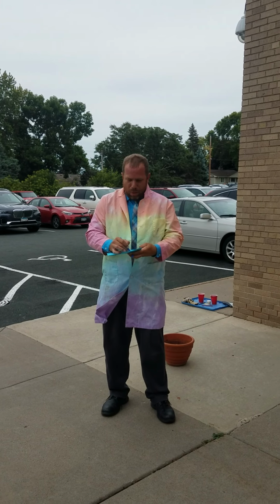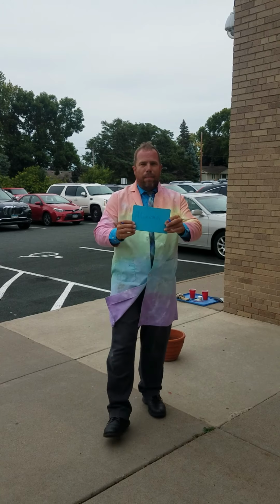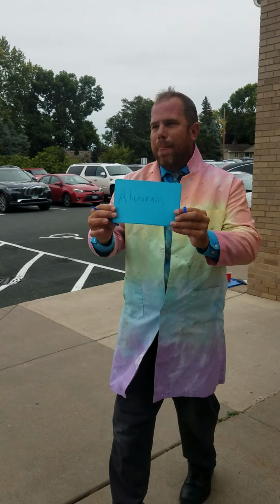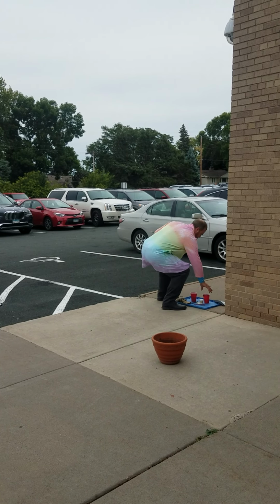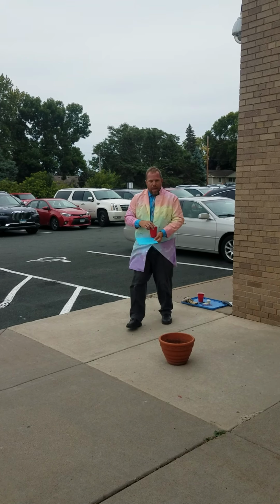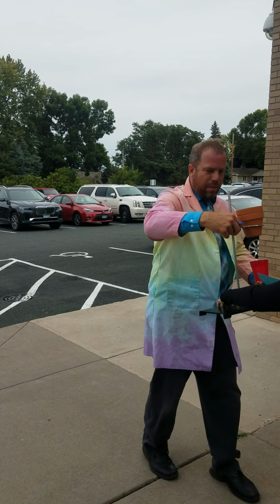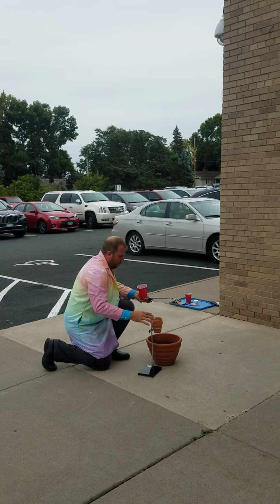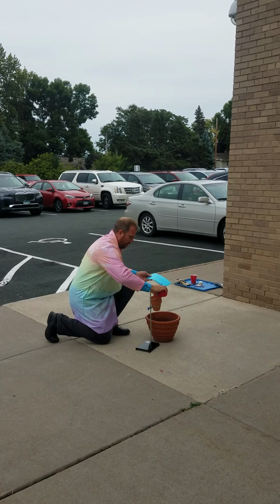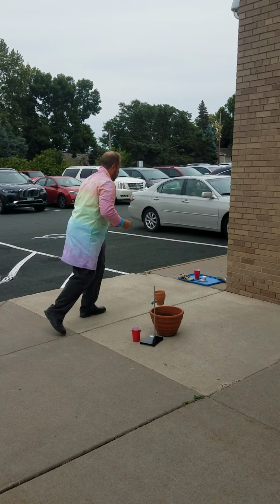Okay. And so the first thing we're going to do is we're going to take a product called aluminum. And I'm going to write that out because when you go to the recording later, you can see it. This is one of the things we're going to use, aluminum. So I have my aluminum here. And don't tell my wife, but I borrowed some of her flower pots. I'm going to put some of the aluminum in here.